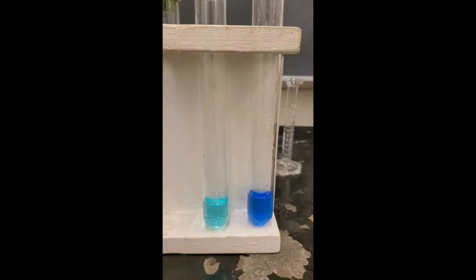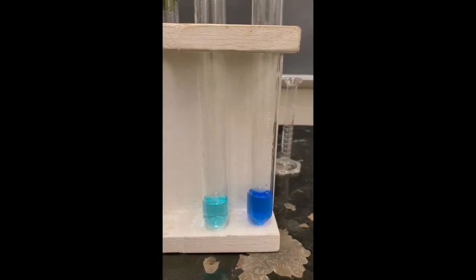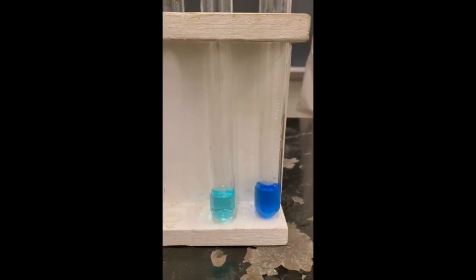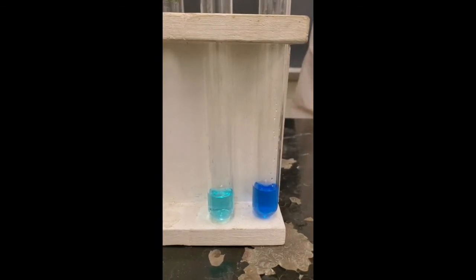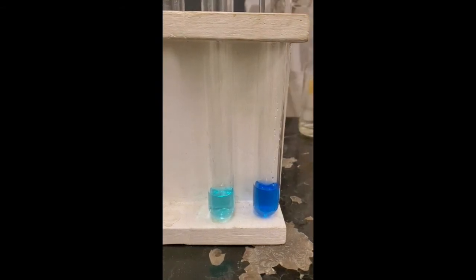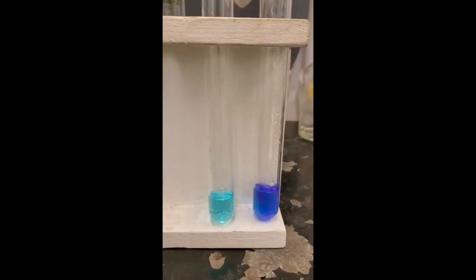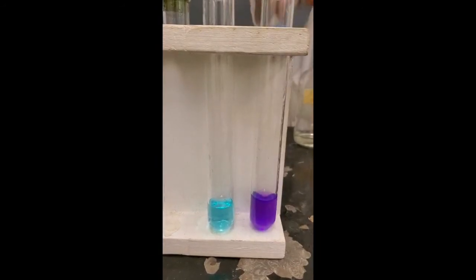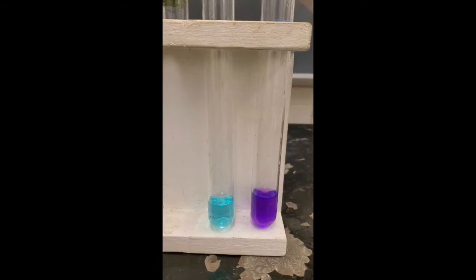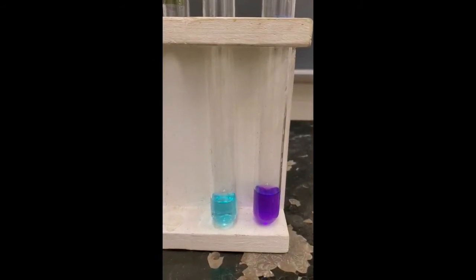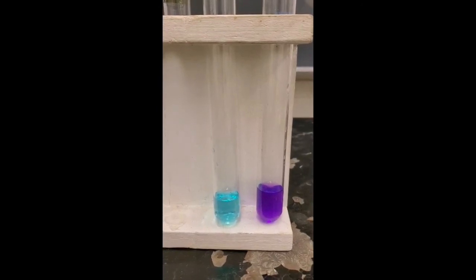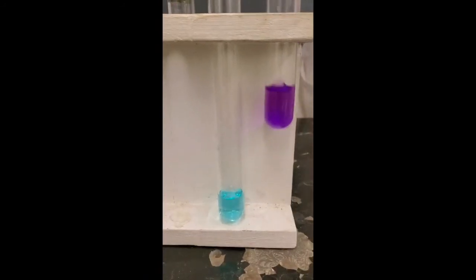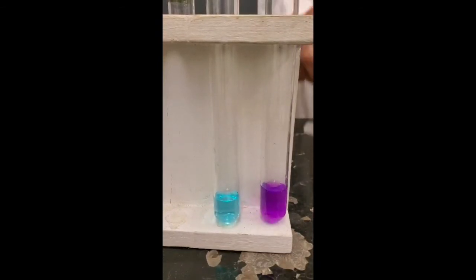Now what I'm going to do is add, I think I should add another one, right? Because the formation constant for the second one is also large. So let me pour another milliliter in there and see if you see any evidence of reaction. Ready? Is it changing color? Yes, it is. Now let's add another one and see if it changes color. And that's going to be the third one. Change a little bit, didn't it? It did change again. Now that's the third one on there now.